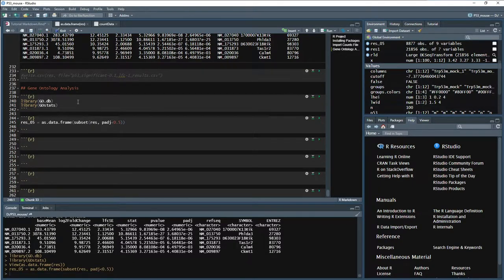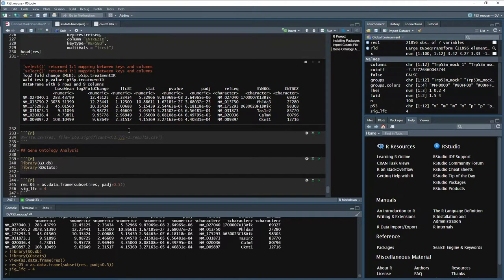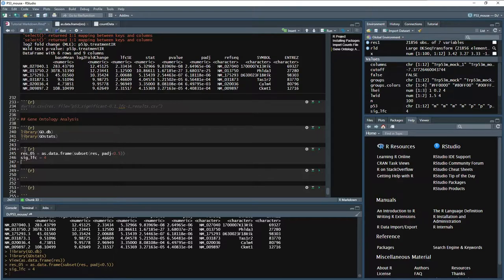Another thing that we have to set is the other threshold. Last time I mentioned log fold changes that are common. Some people do 2, some people do 4. And so here we can set our log fold change threshold at, say, 4. We can do sigLFC, and then later on we can call this instead of typing it out, and it's harder to make a mistake for the up and the down if you can set one variable and then just call it. So how about 4? Great.